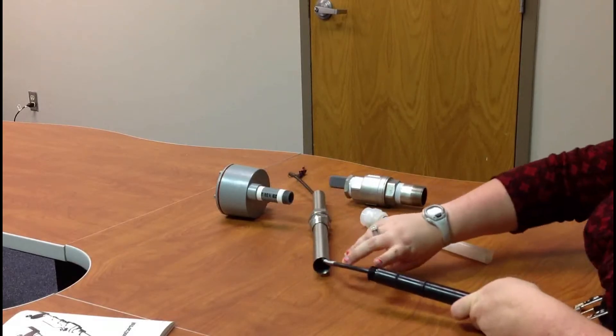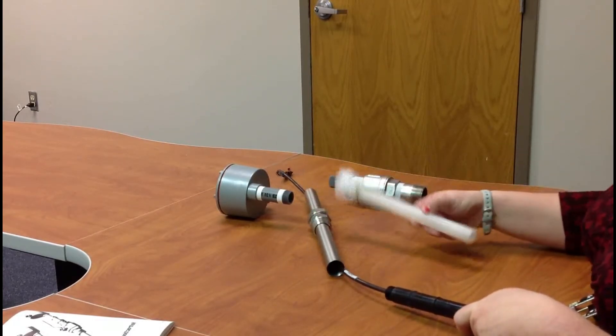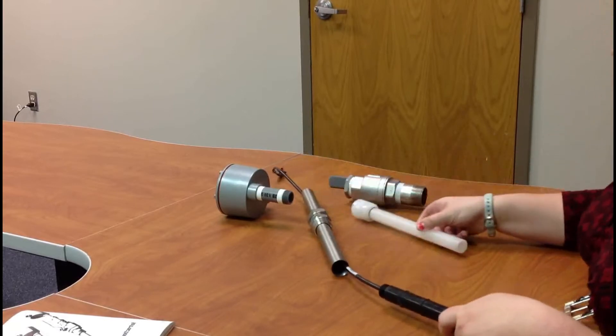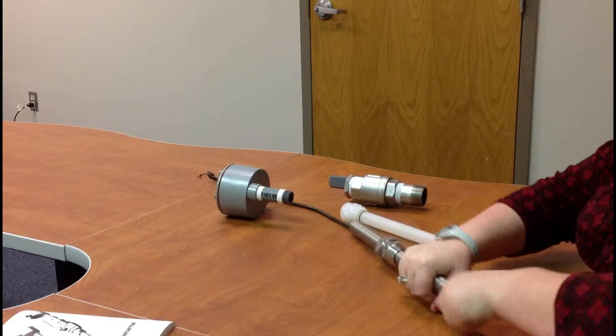And then also, I want you to note, there's a thread here that when we put it in here and this Kynar body goes all the way through, it'll actually thread on here to seal it too. So that's what you're threading on to in just a moment.